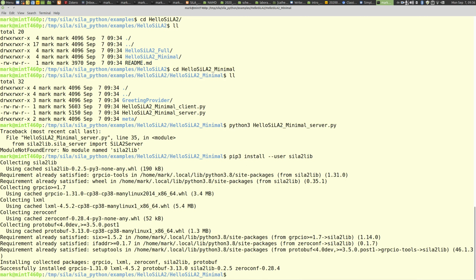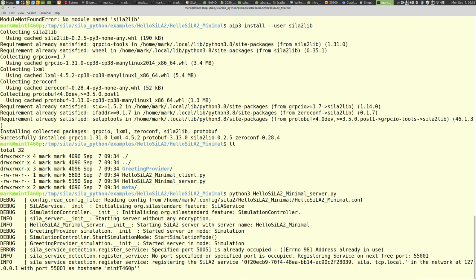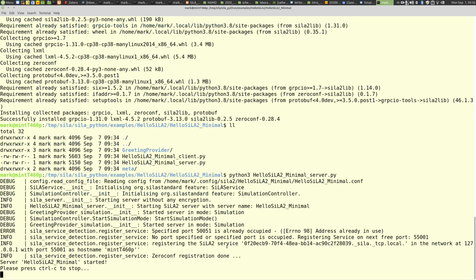In my case, it's even faster because it's a little bit cached. In your case, it would take like a minute or so, depending on the internet connection. It could be also much faster if you have a broadband connection. So again, start the server, and here it is. It's up and running. The server tells something about the port that it is using. This is a UUID the server uses, or an identifier string, and here's the IP address that is currently used. So it's the local host computer. Okay, so this is the server.